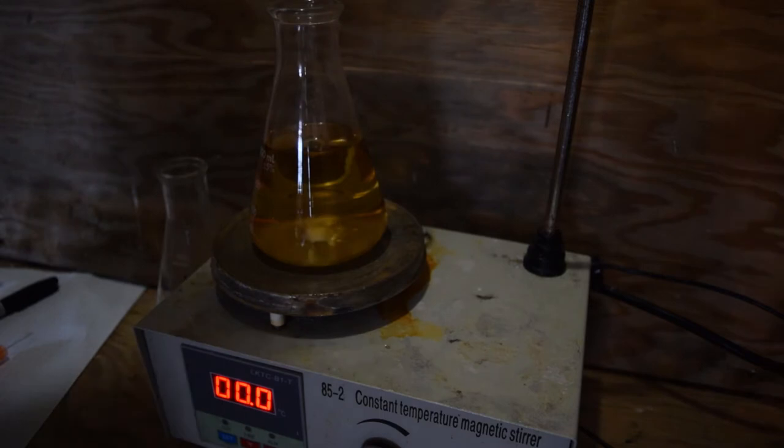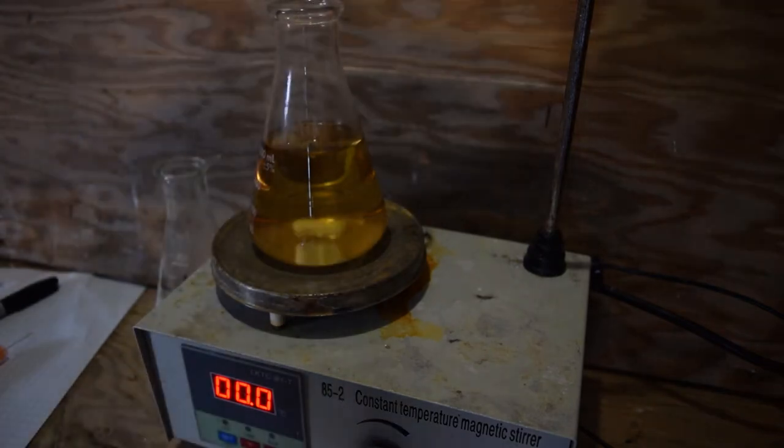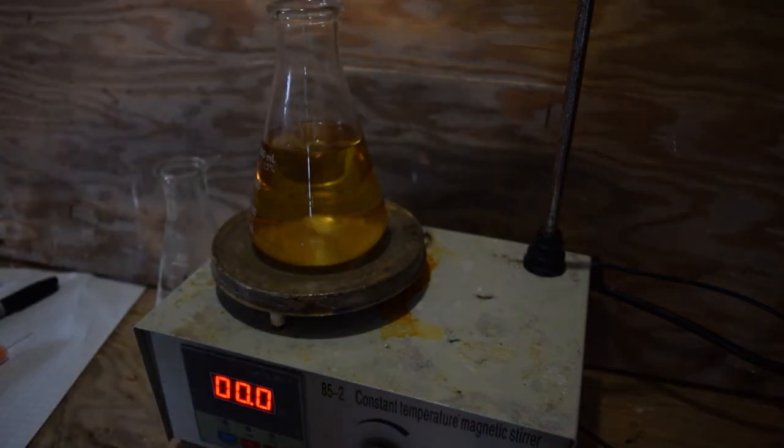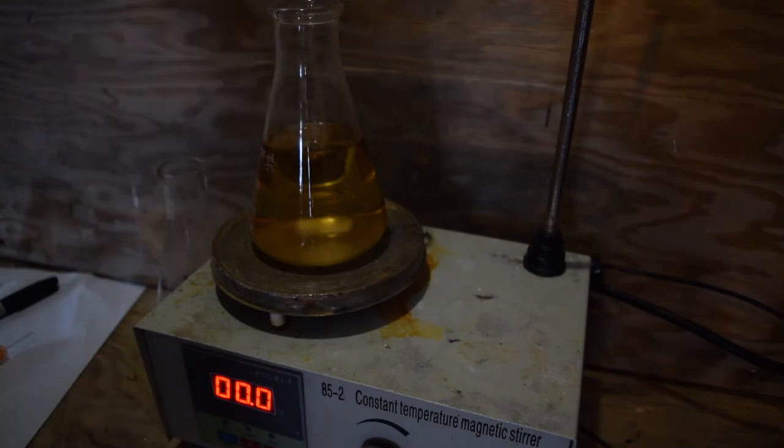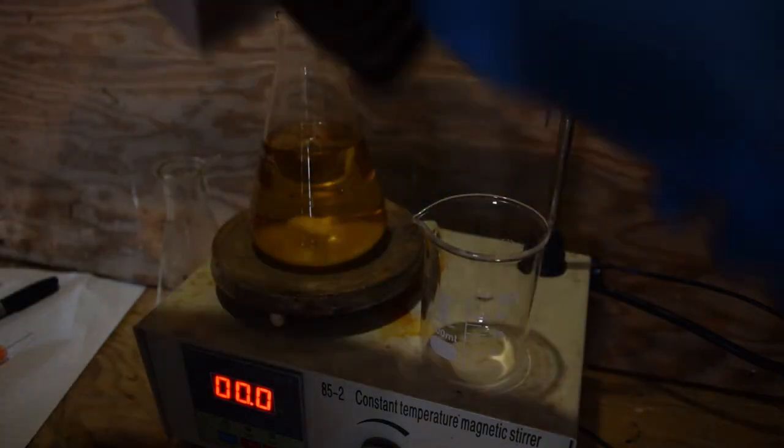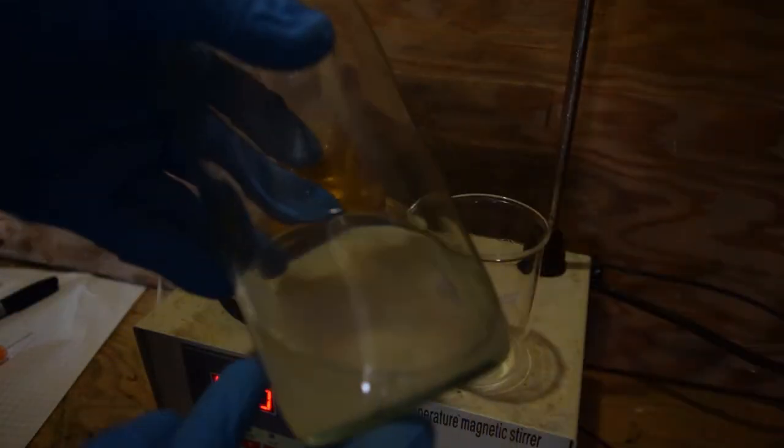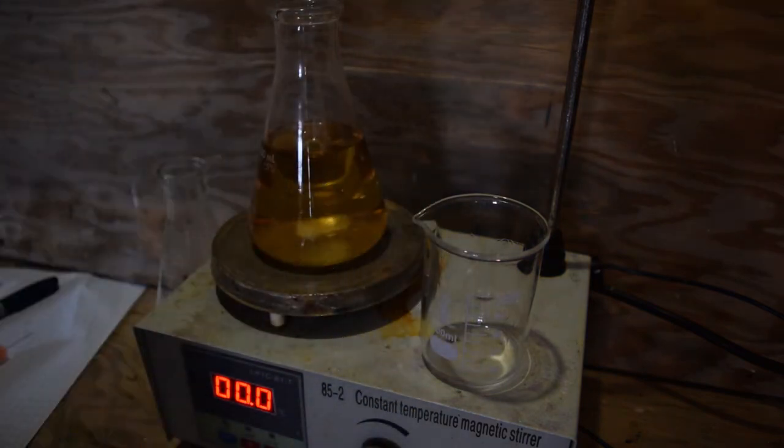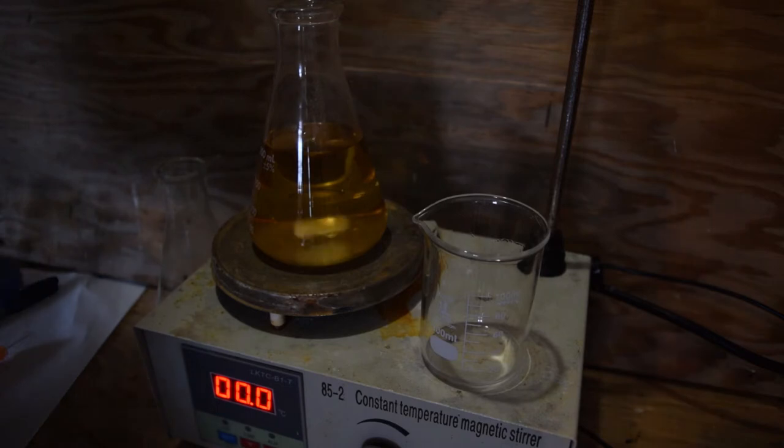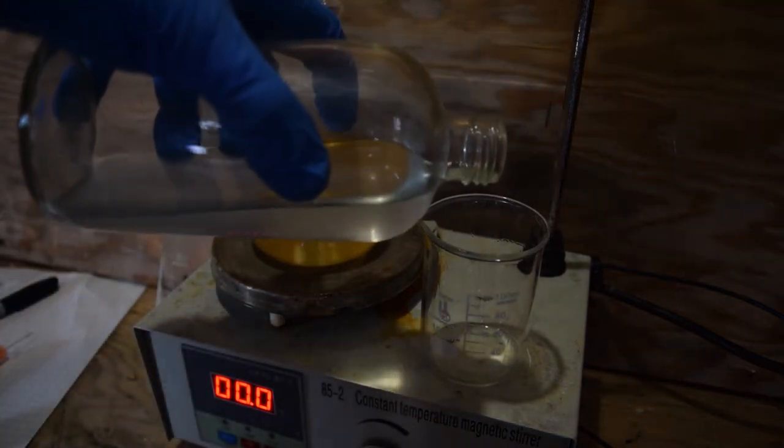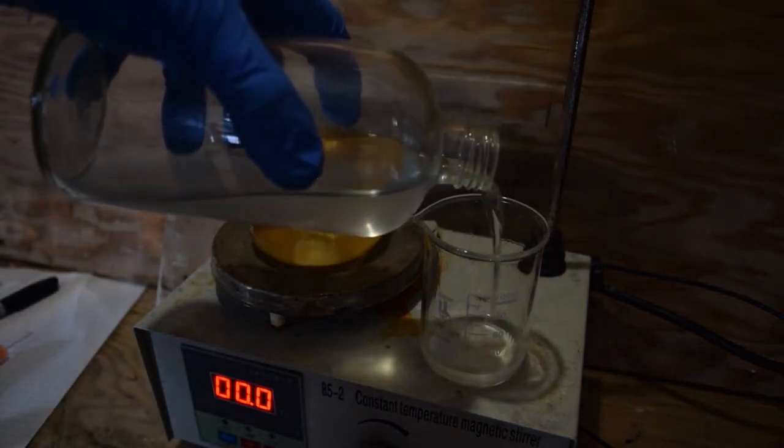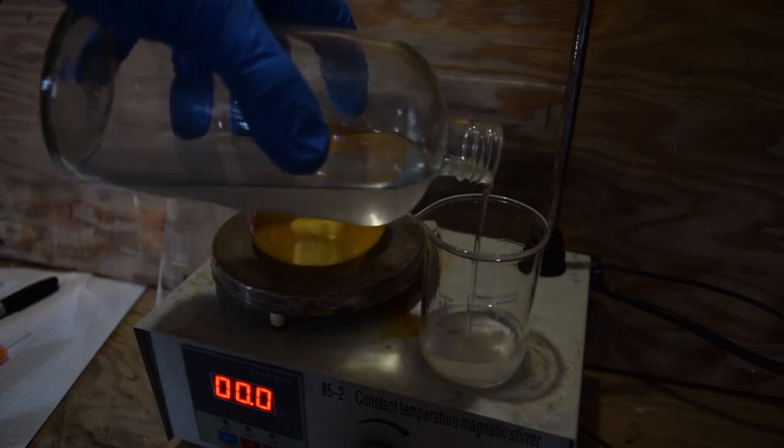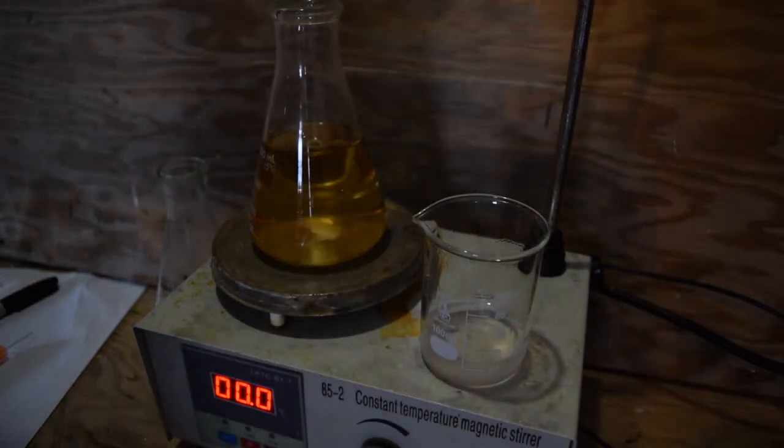All right, chloroform's going in. And on second thought I might have wanted to use a larger flask, but too late now. All right, finally we're going to add the sodium hydroxide and ethanol mixture. Now this is going to kick off the reaction. It won't be vigorous or anything, but we do want to work quickly to minimize the odor.